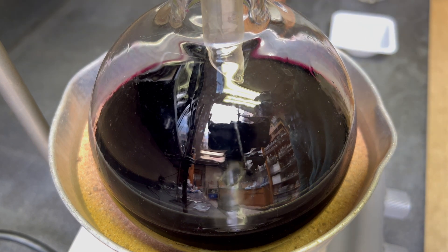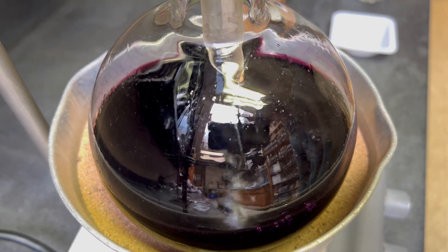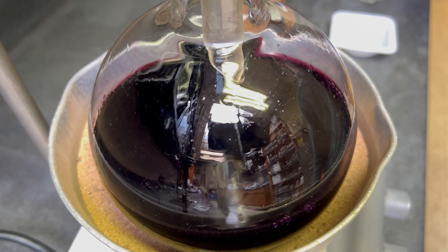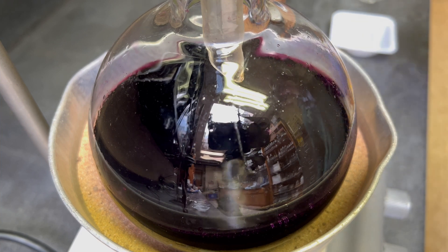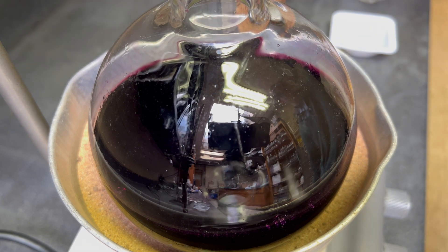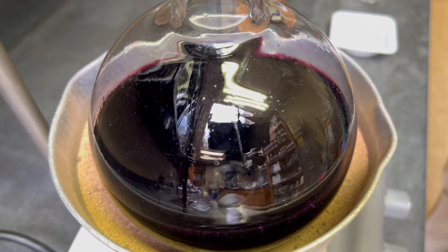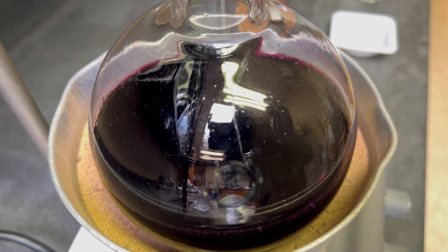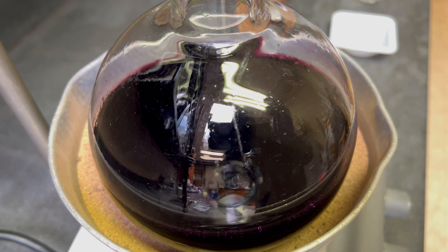Due to toluene's immiscibility in water, the reaction will occur where the two layers meet, but this will be extremely slow. One option is to stir vigorously; the other is to use a phase transfer catalyst. A phase transfer catalyst is miscible in both layers, and dual miscibility allows for the chemicals to mix and react. Many phase transfer catalysts work for this reaction, but I will not be using a catalyst in this reaction as it's just another source of impurities, so I'll be using the vigorous stirring method.